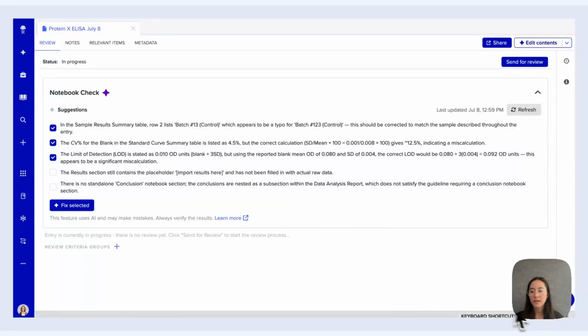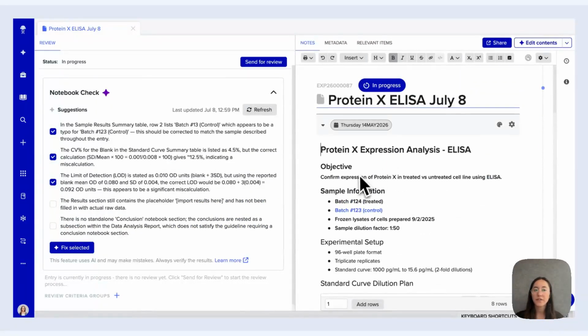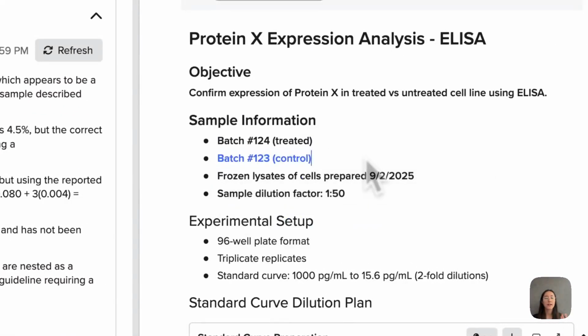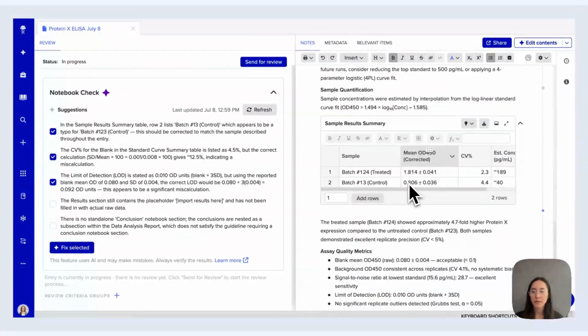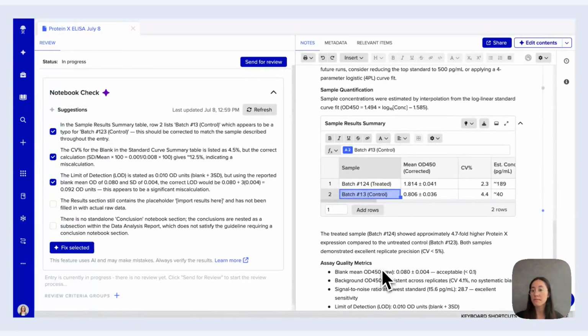So I'm going to go ahead and split my workspace here on the right-hand side and scroll to the top of my entry. The first thing that's called out, which is to the first checked item here, is that the sample results summary table has a batch number that is likely incorrect. You'll see that in my sample information, the batch number 123 is what's listed, so that's likely, in this case, what the actual correct sample number is. And if I scroll down to the summary table, you'll notice that batch number 13 is listed, which is in fact incorrect. So this is a great way for you to use Notebook Check where there might be small typos that end up making bigger impacts downstream, which we can use Notebook Check to fix and catch early.